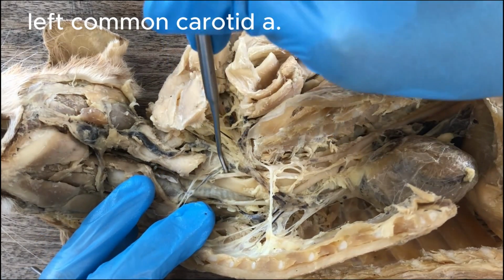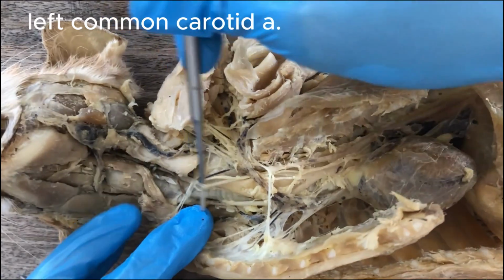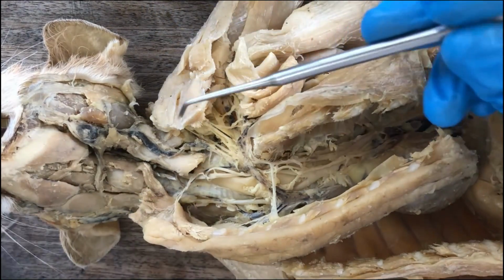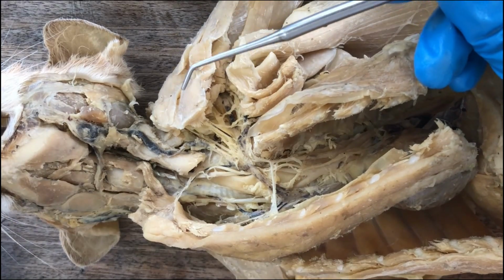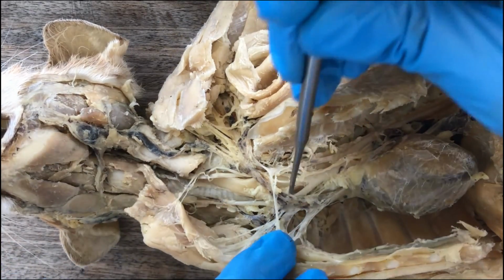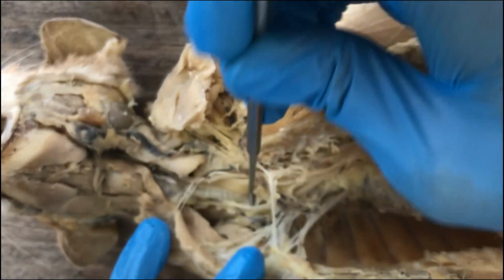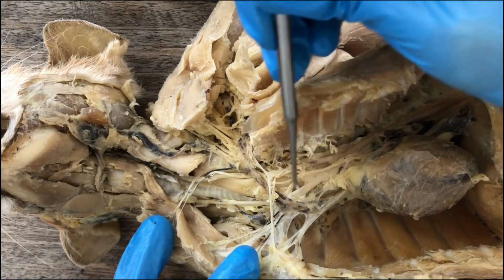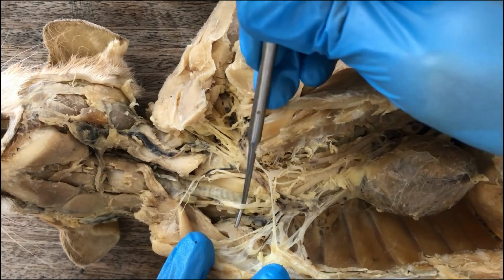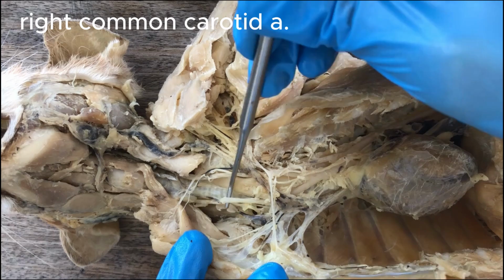This is the continuation of the left carotid artery to supply blood to the head and also the brain. And then the remainder of the brachiocephalic artery will split again, now giving rise to the right common carotid artery.